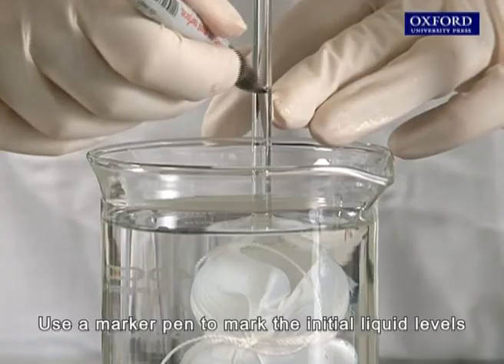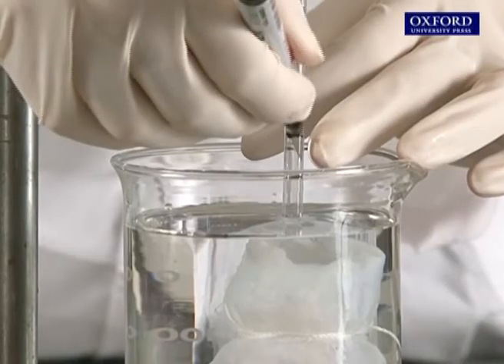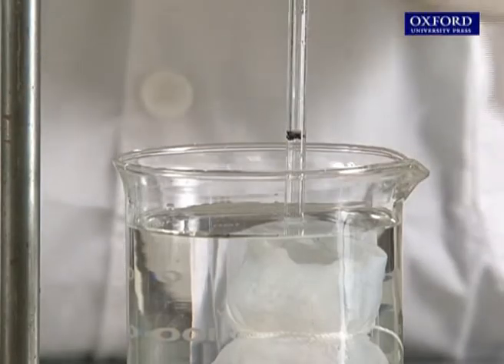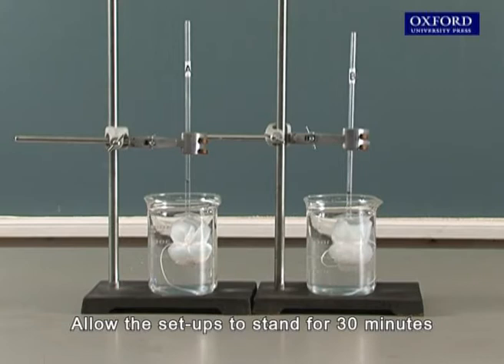Use a marker pen to mark the initial liquid levels in the thistle funnels. Allow the setups to stand for 30 minutes.